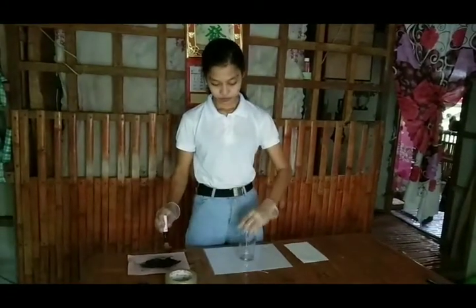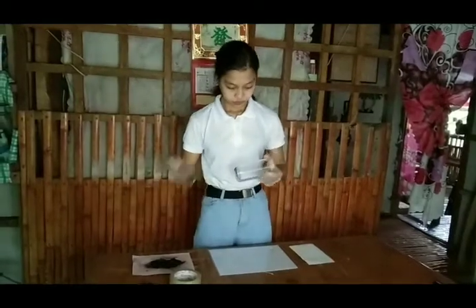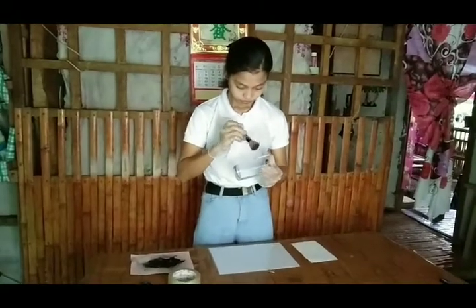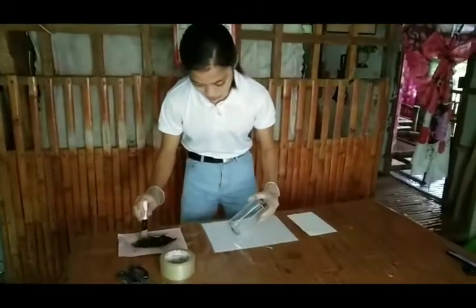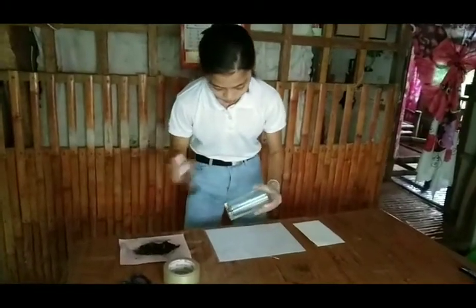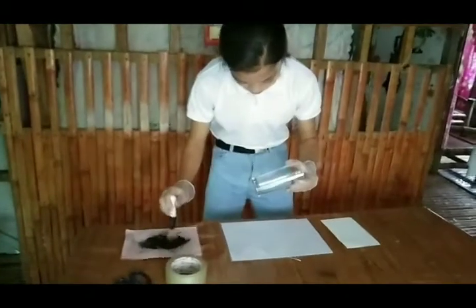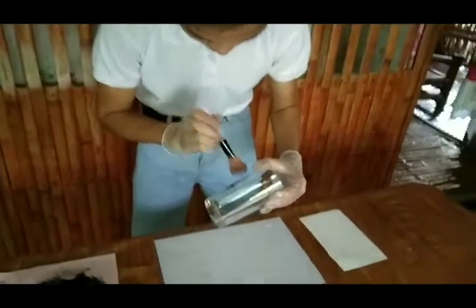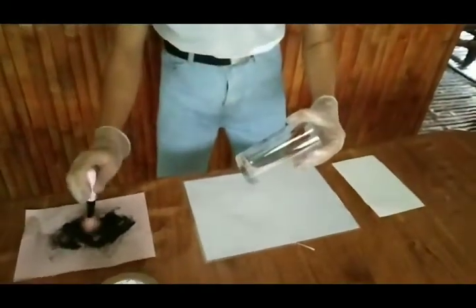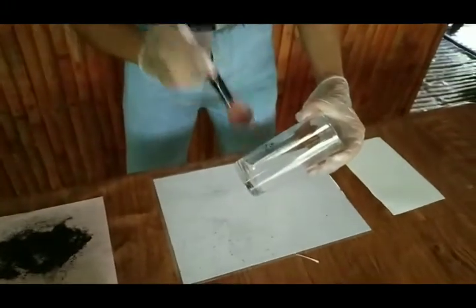The most common method of developing latent prints on non-porous objects is to physically enhance them by applying fingerprint powder. Fingerprint powder is applied by brushing it onto the surface and works by mechanically adhering to the oil and moisture components of the latent print.